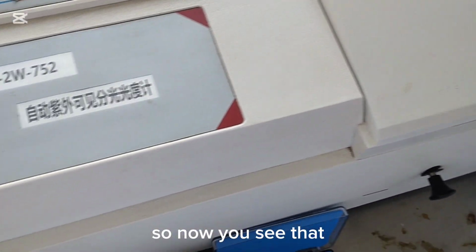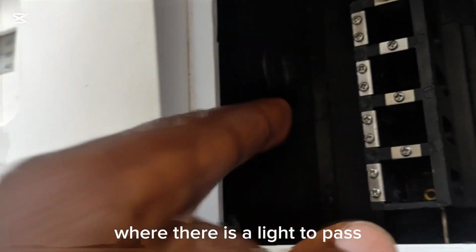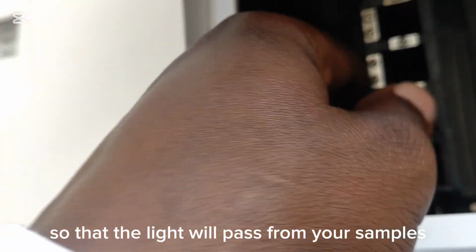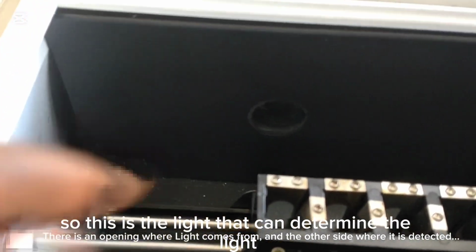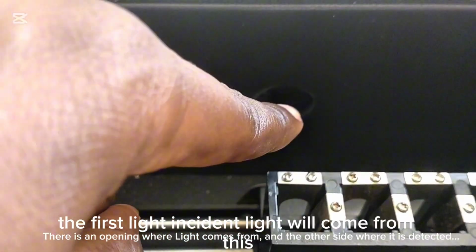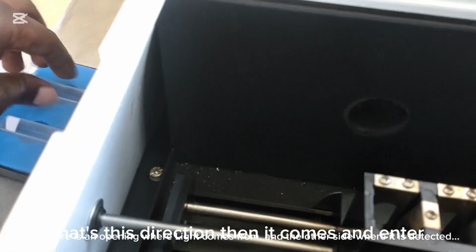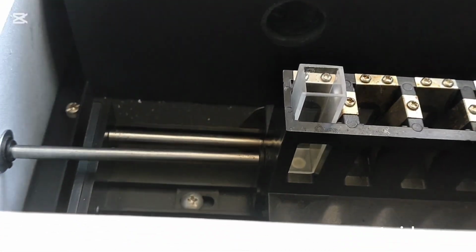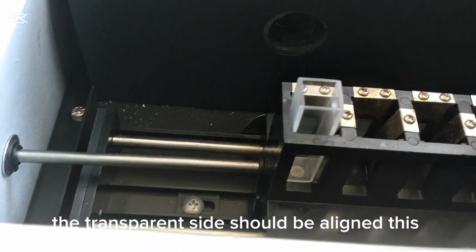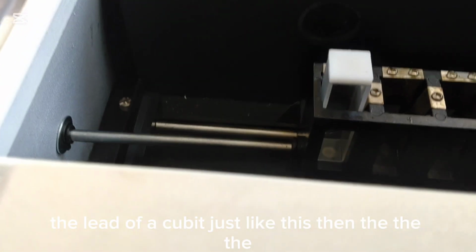So now you see that inside this spectrophotometer we have the place where there is a light to pass, so that the light will pass through your samples from that angle. The first light, the incident light, will come from this direction. Then it enters your sample. You see the transparent side. The transparent side should be aligned this way. If you want, you can also put the lid on the cuvette, just like this.